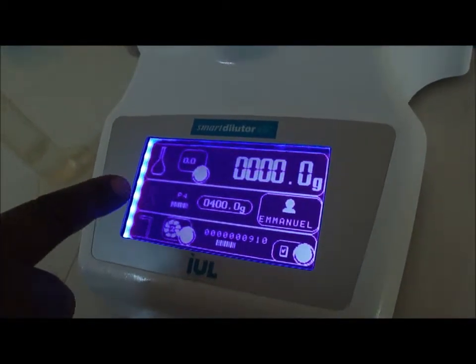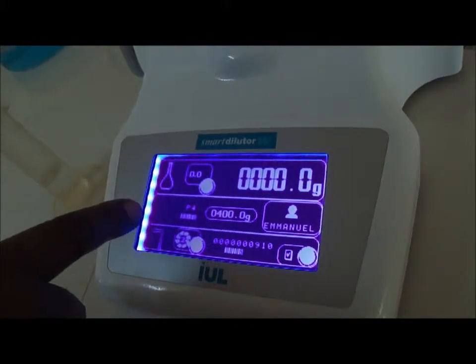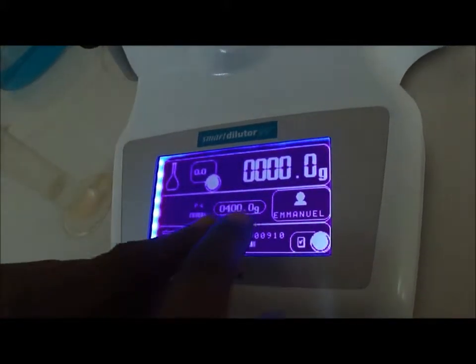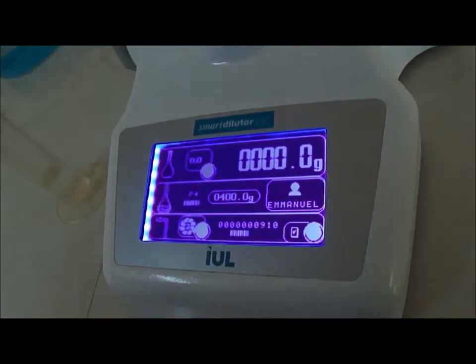Now, this symbol is no more a shrink. This one is showing that I'm making a dispensing, and that the final weight that is targeted is 400 grams.